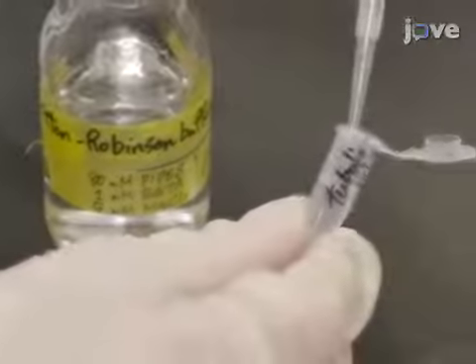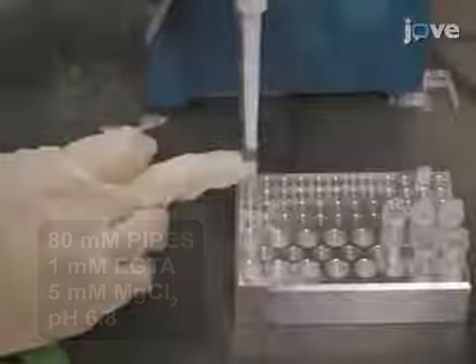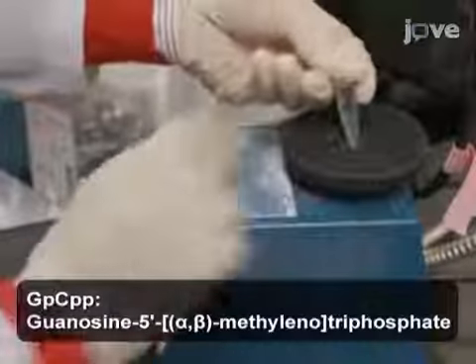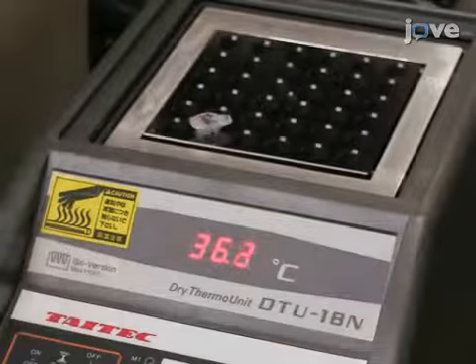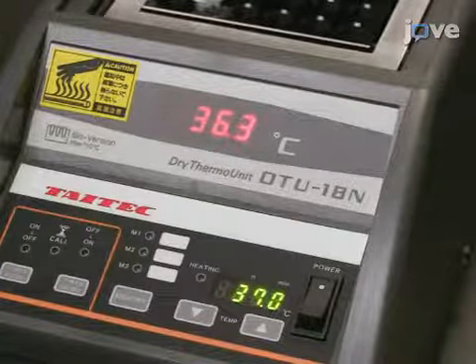Now, prepare a 0.5 weight % tubulin solution in Britton-Robinson buffer on ice. Mix 50 microliters of the tubulin solution with 5 microliters of GPCPP. Then, incubate the solution at 37 degrees Celsius for 3 hours to obtain a stable microtubule, or MT, nucleus.